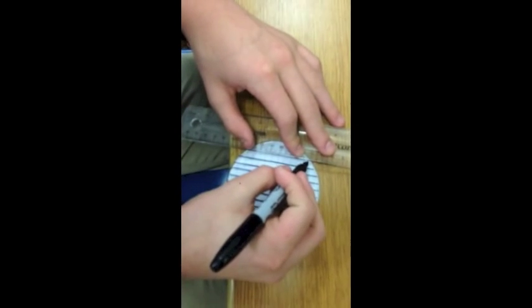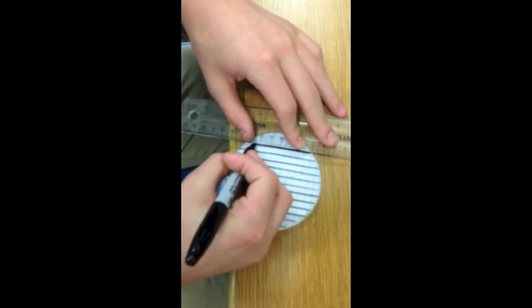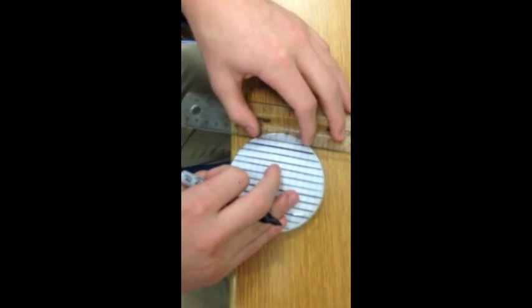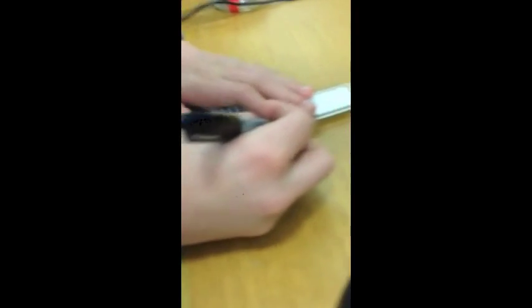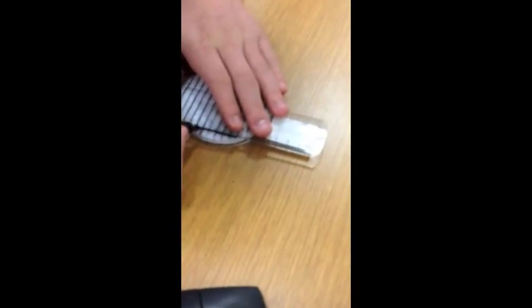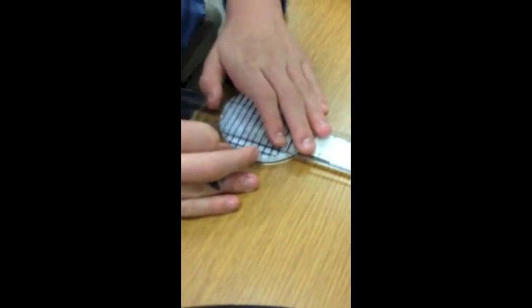Here, we are creating a template that is the size of a petri dish with several boxes that will be used for measuring the growth of the bacteria by seeing how many boxes the E. coli took up and comparing that to the other petri dishes.